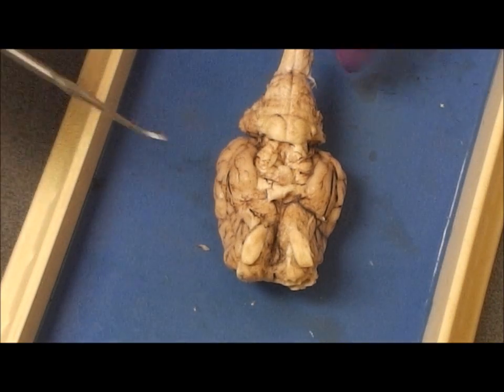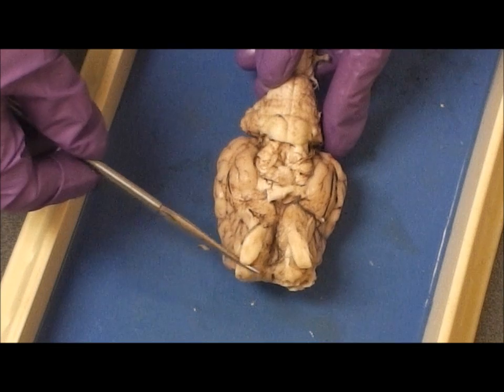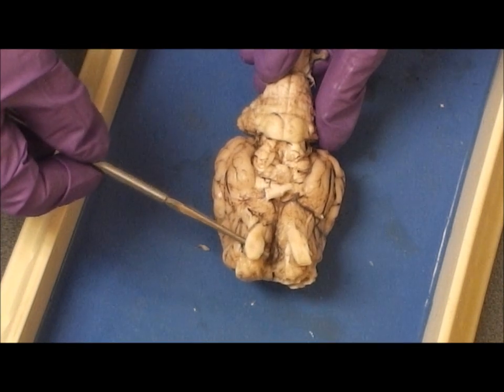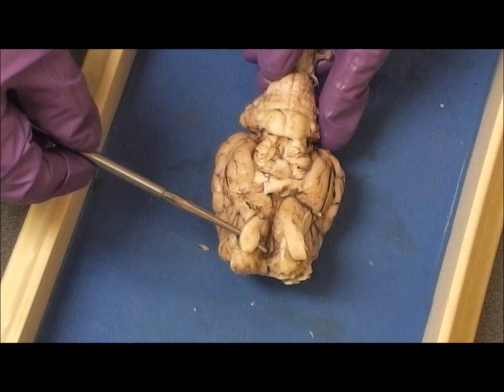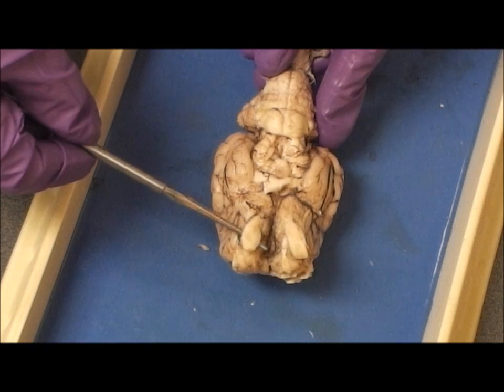We will continue the review of the sheep brain. The cranial nerve structure associated with the sense of smell is the olfactory bulb.